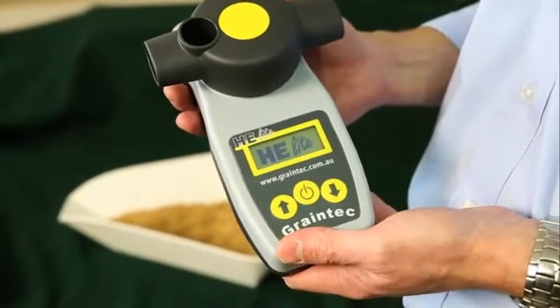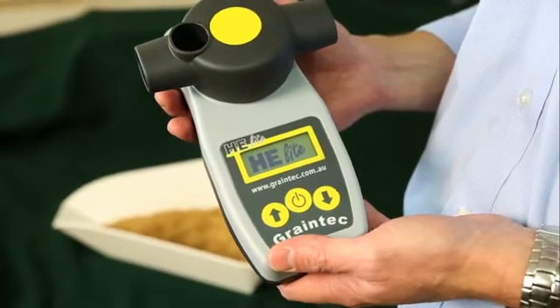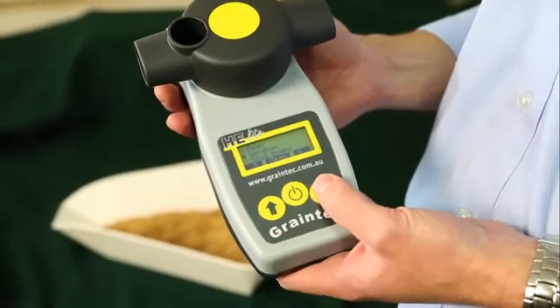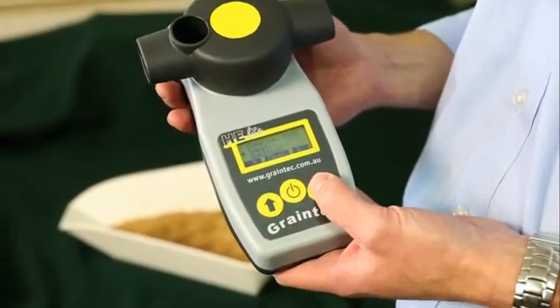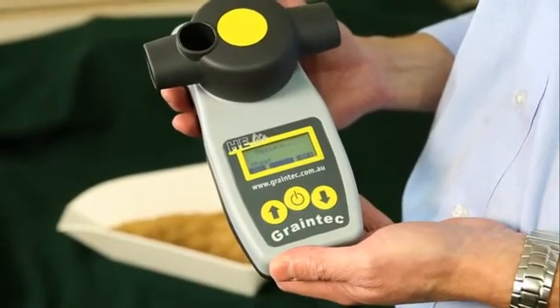Turn on the instrument and select the right grain from the menu — in this case we want wheat. Press the button again to read, and that will take about 10 seconds.